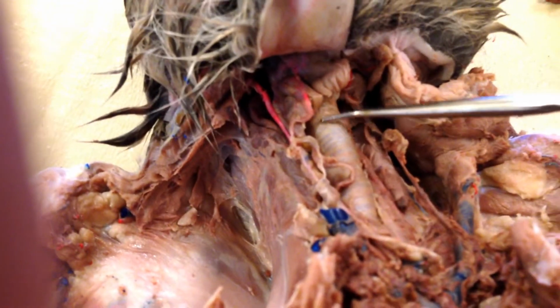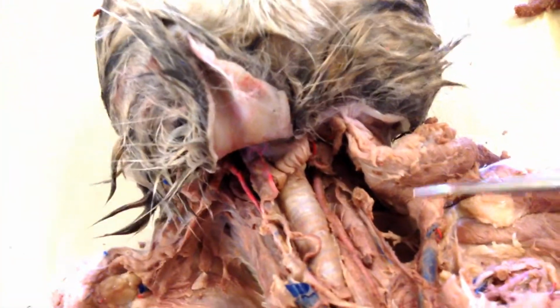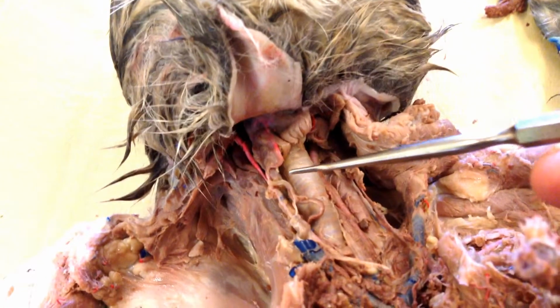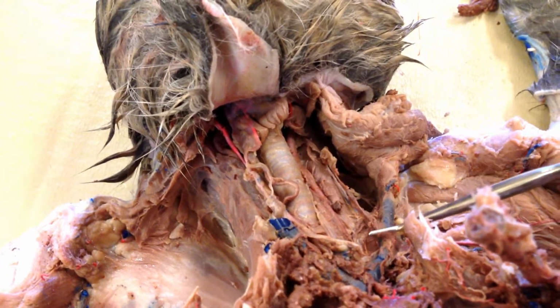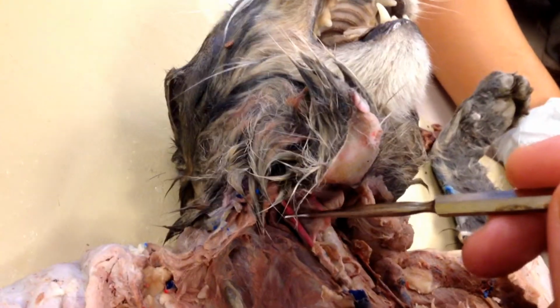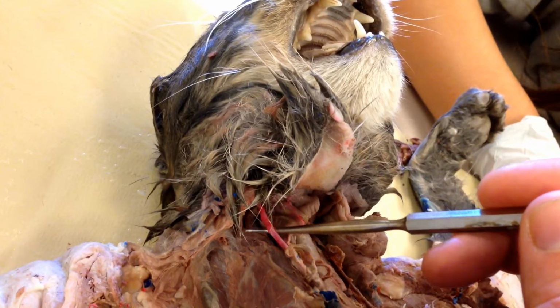Number 48, this rigid white clearish tube that goes up into Kitty's mouth. 48. Up in the neck area there is a set of very large veins that drain the blood from the head region. This is 48. And then 49, the associated arteries that bring blood up to the head. 49 right here.